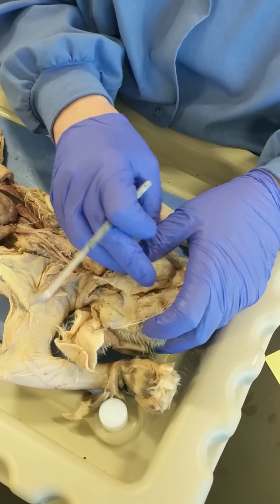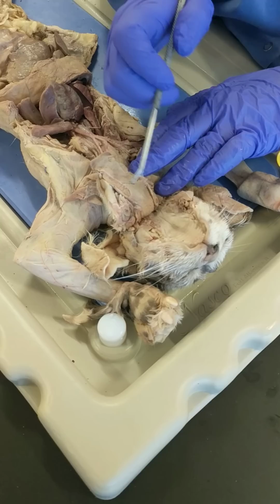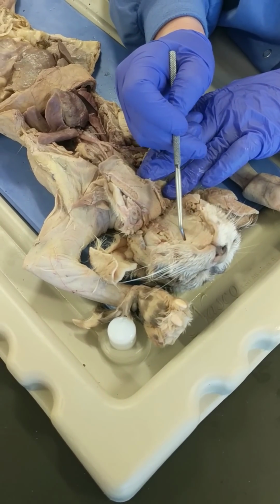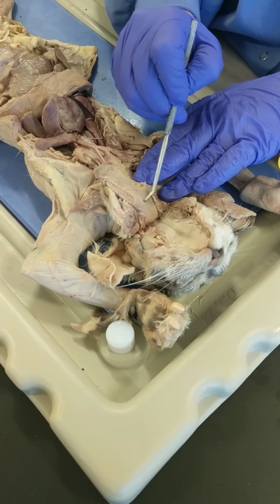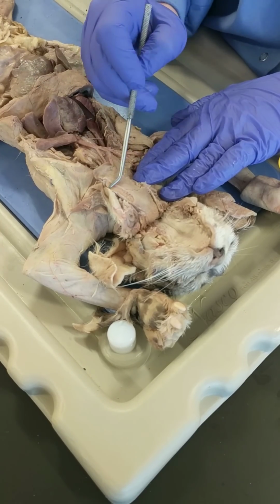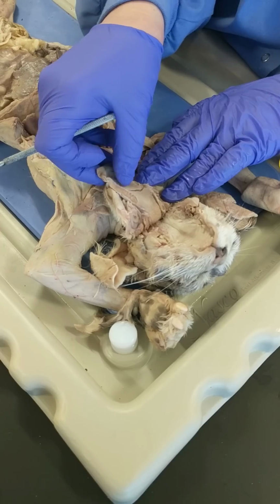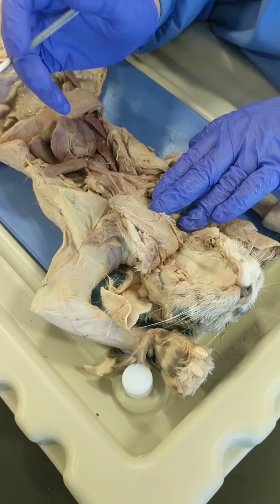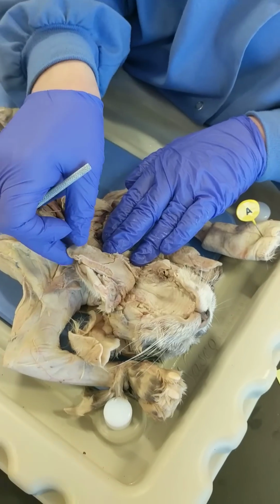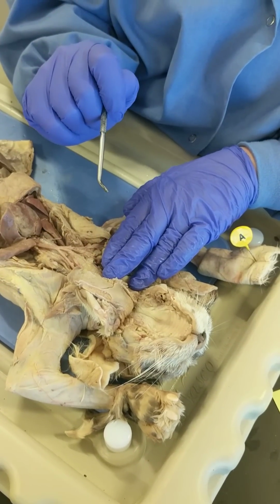And if we open the oral cavity, you see the hard palate, of course the teeth, hard palate, soft palate, and then the tongue, which has kind of been mangled a little bit. And you can feel on the tongue, I'll be quiet for a minute so you can hear the scraping. Those rough scaly things are called filiform papilla, and cats use those for grooming.